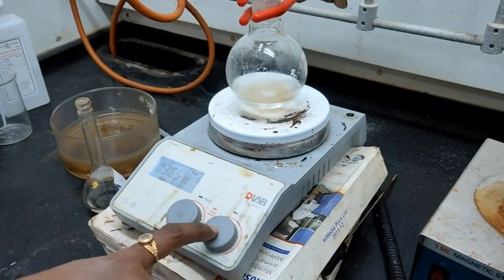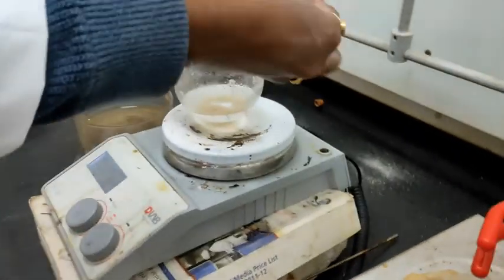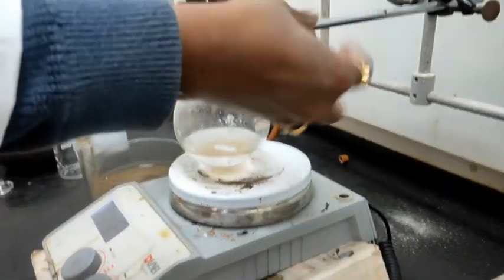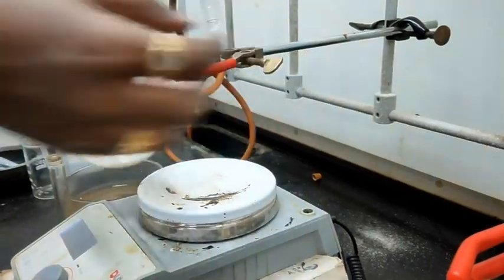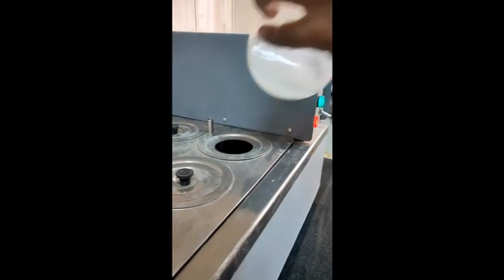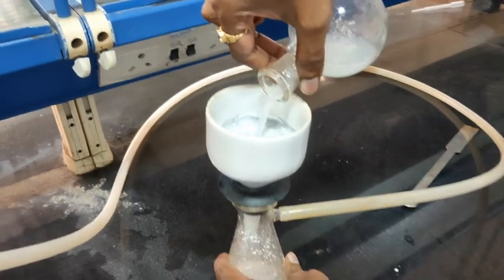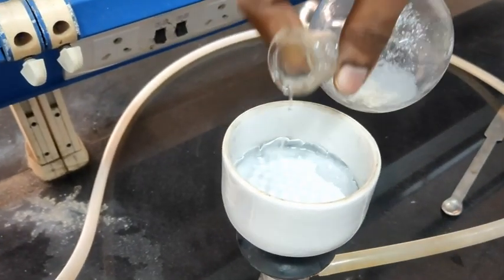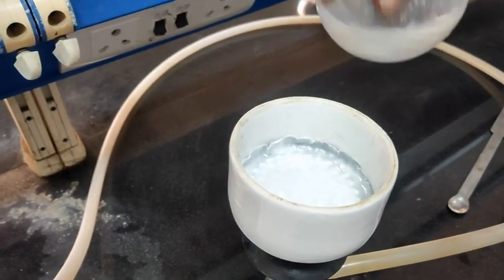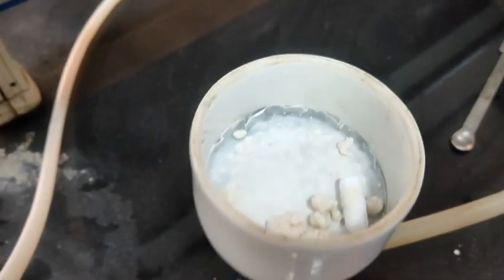Evaporate the ether solution from the reaction by heating on a water bath at 35 to 40 degrees Celsius. Add 35 ml of distilled water and allow the desired product, benzanilide, to crystallize. Filter the product in a Buchner funnel.